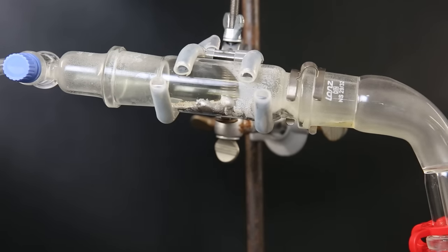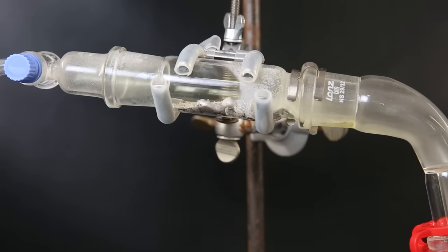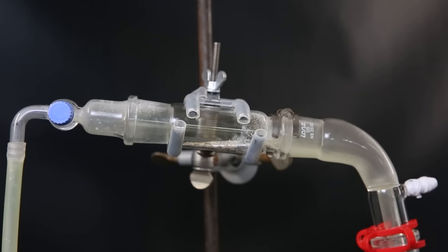So it has to condense further into the apparatus. What is probably better is to put two condensers, with an extra one added right next to the adapter. Also, a slight incline is not really necessary if it all vaporizes. So it can just lay fully horizontally so that the tin doesn't move.